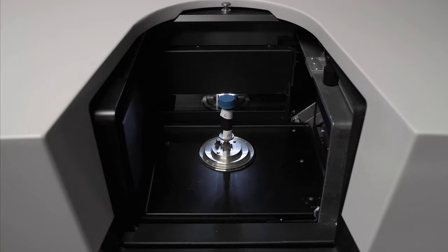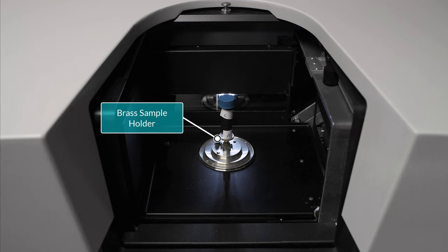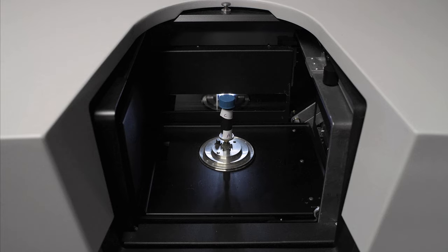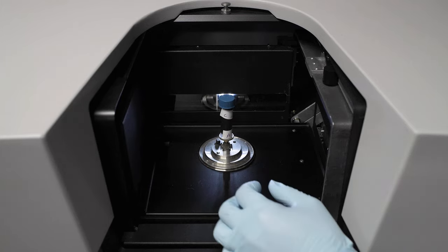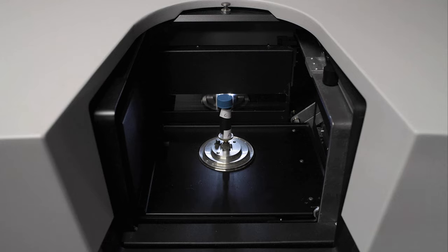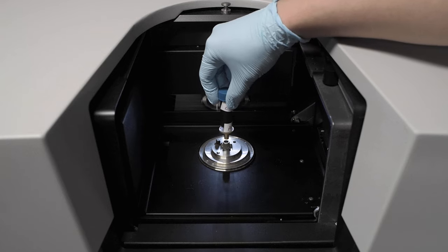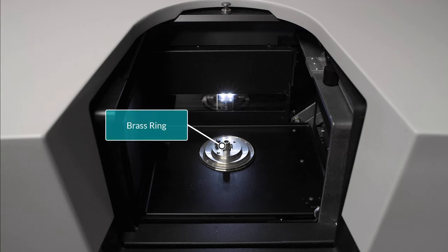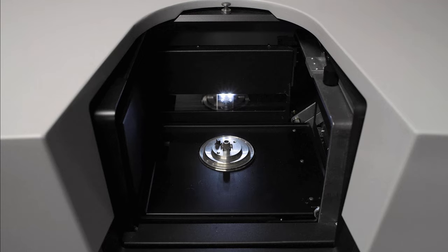To begin with sample mounting, first we need to place the sample on the brass sample holder. The brass sample holder is either located in the toolbox next to the scanner or on the object manipulator inside the sample loading chamber from the previous scan. If it is still on the object manipulator, gently turn the brass ring in a counterclockwise direction to release it. Do not apply significant torsion to the brass ring and object manipulator, which will misalign the calibration and potentially damage the object manipulator. The brass sample holder can then be pulled straight up.